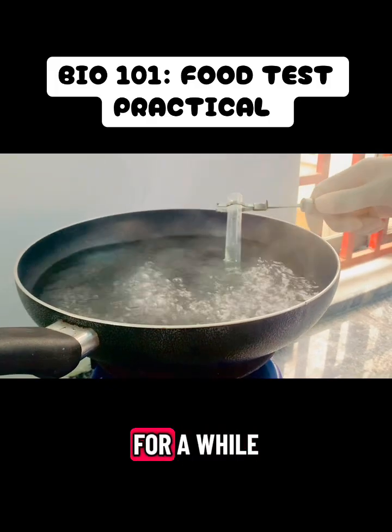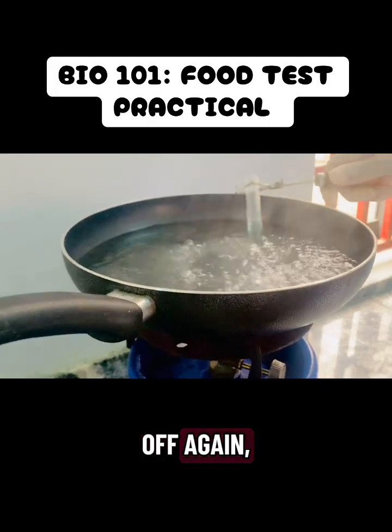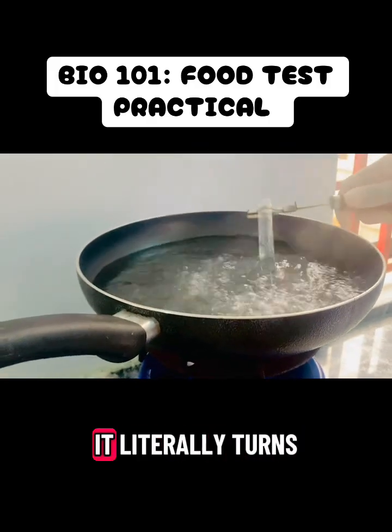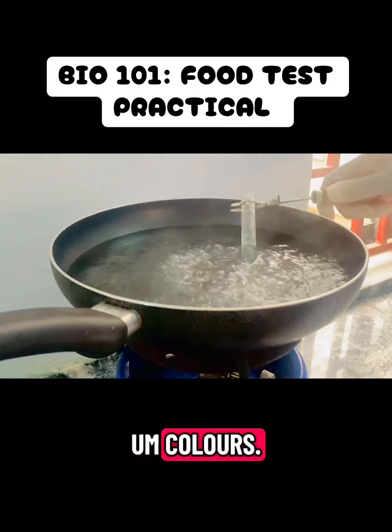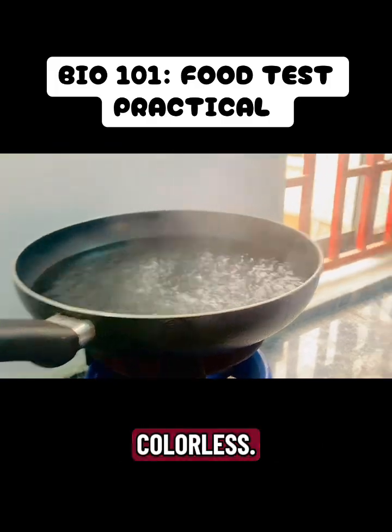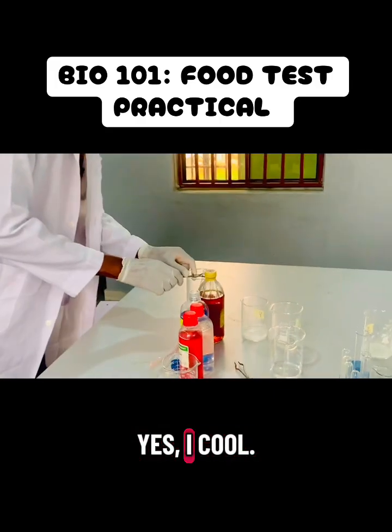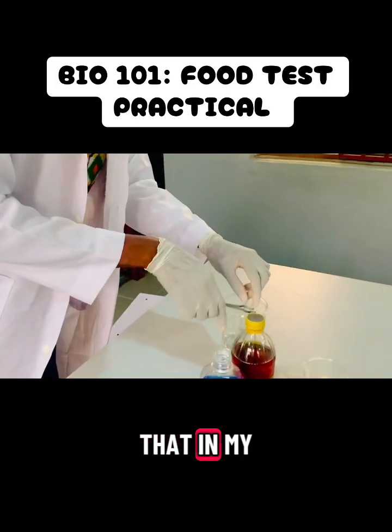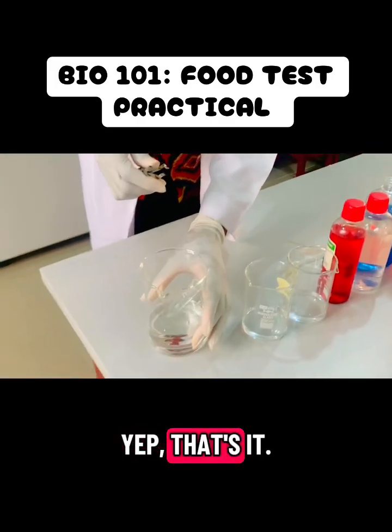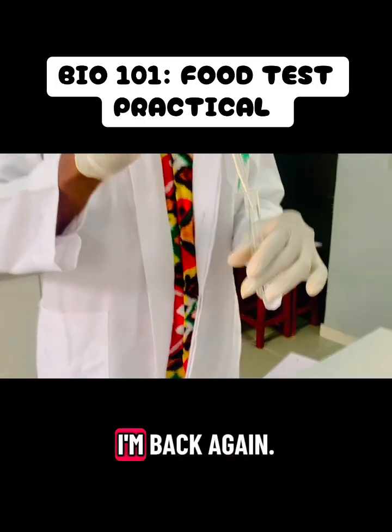I boil for a while, and guys, let me tip you off again. There will be no color change. In fact, the solution becomes colorless. So what do I do next? I go ahead to cool it off in my beaker filled with water. After cooling off, just stay for a while, and voila, I'm back again.